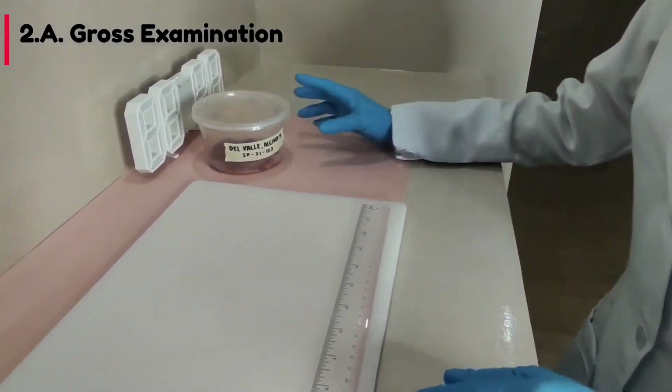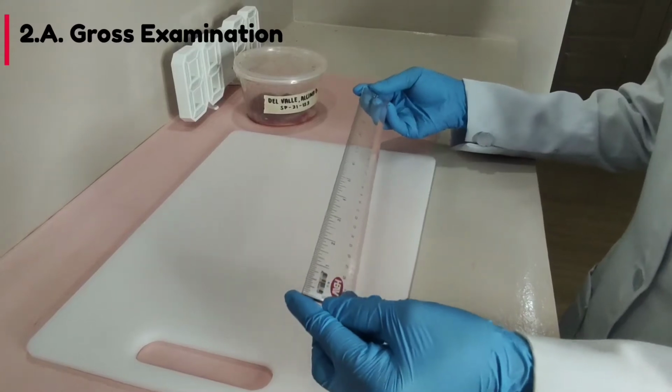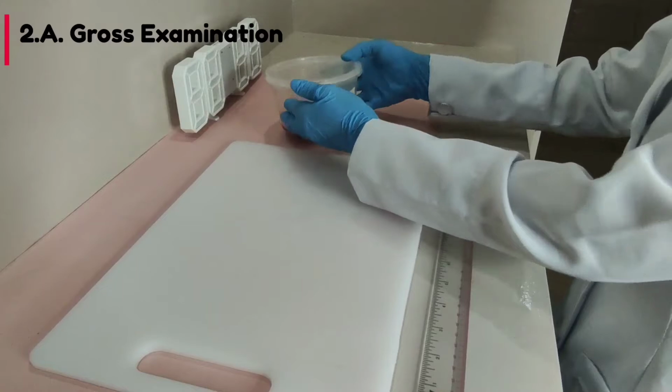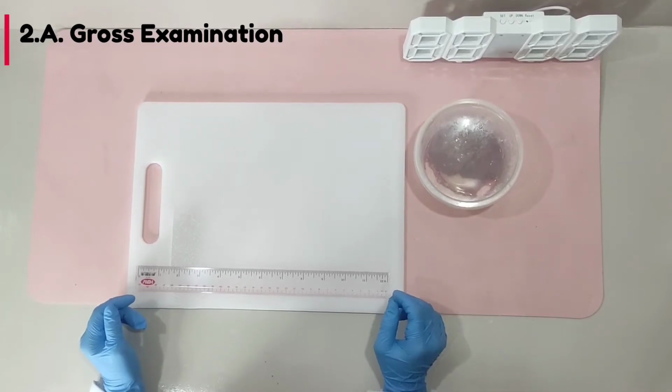The materials for this process are gloves, a clear ruler with graduations for precise measurement of the specimen, a specimen of choice, and a clean chopping board where the whole procedure will be conducted. Let us now identify the specimen.